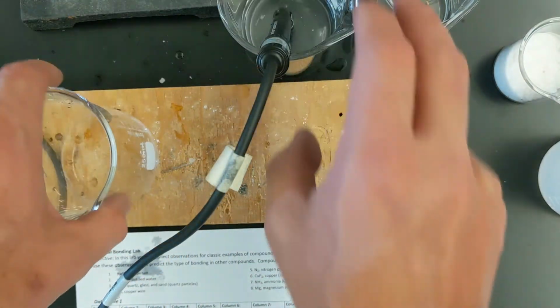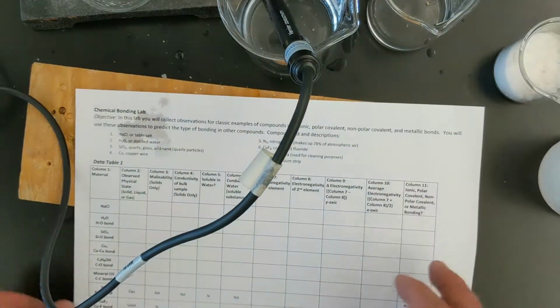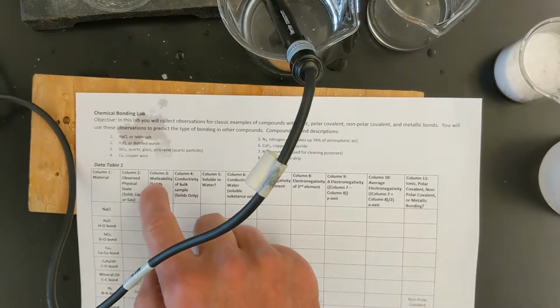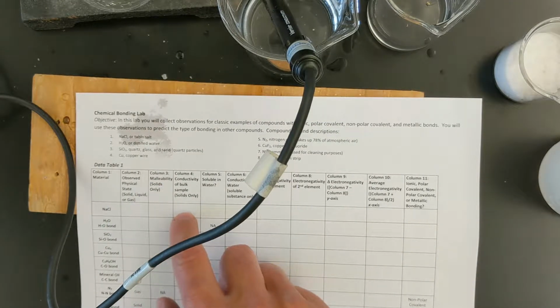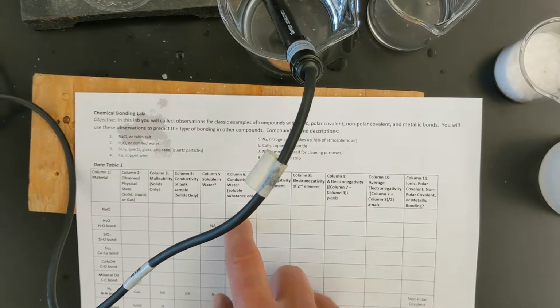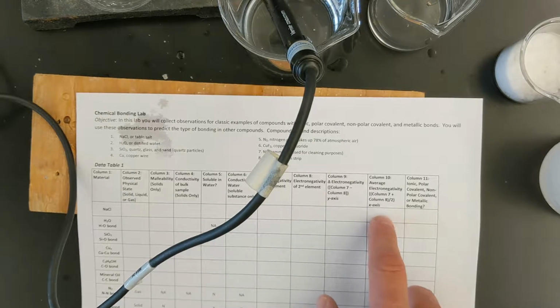So that's a good note to make on your guide sheet that you already read. Okay, let's move on. Those are really all of the tests that you need to do for this substance. And so we saw that salt is not malleable, it's not conductive in bulk state, it is soluble in water, and it does conduct whenever it's in solution. And so then in a minute here, you guys will fill out the rest of this.